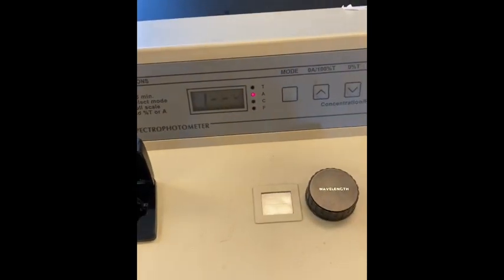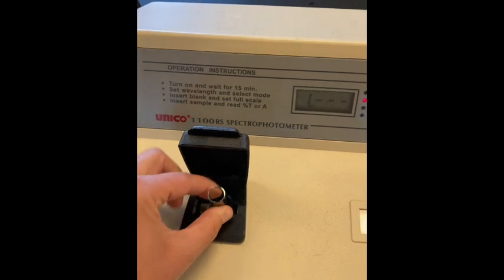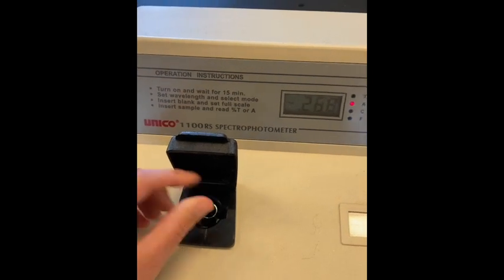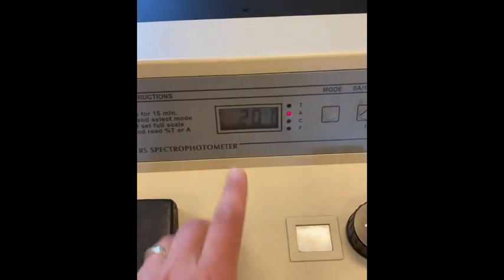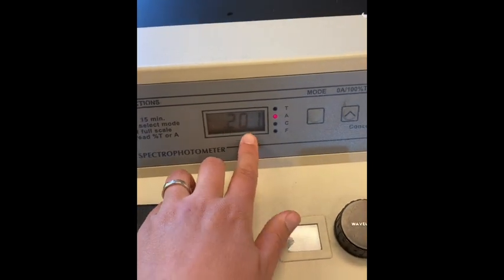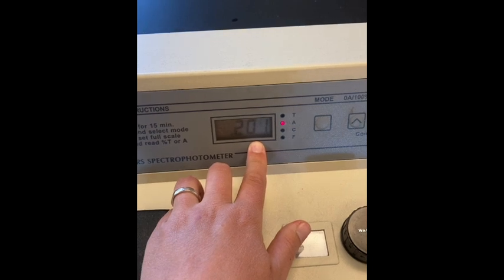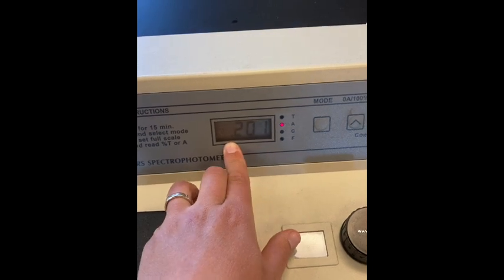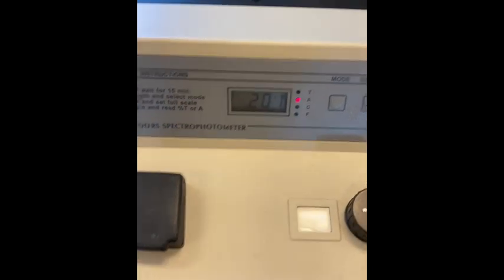Then you put in your next sample. This is the 0.25 concentration, and you're going to record the absorbance value. In this case the absorbance is 0.201 absorbance units, or AU. You record that in your notes.